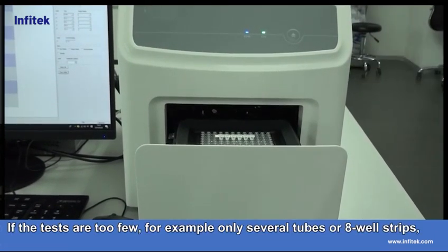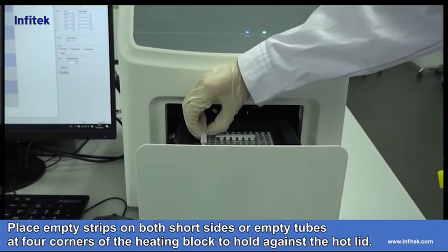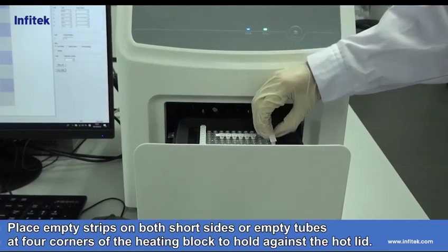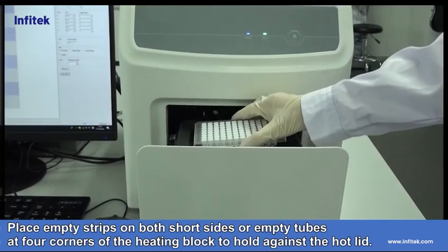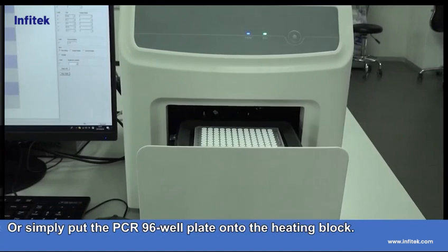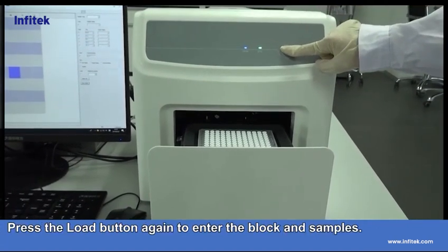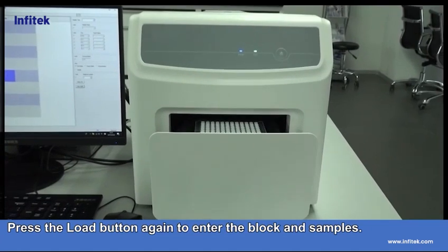If the tests are too few, for example only several tubes or 8 well strips, place empty strips on both short sides or empty tubes at 4 corners of the heating block to hold against the hot lid. Or simply put the PCR 96-well plate onto the heating block. Press the load button again to enter the block and samples.